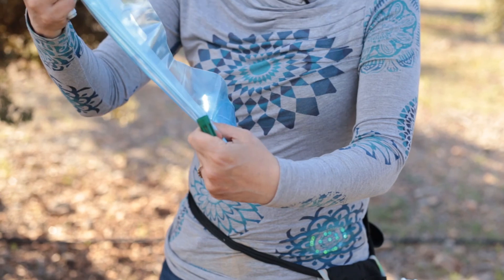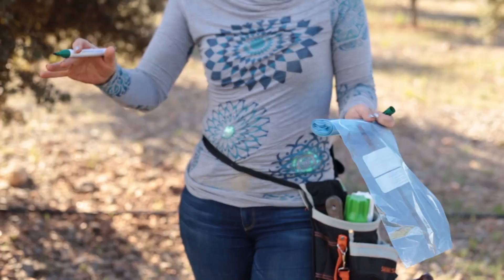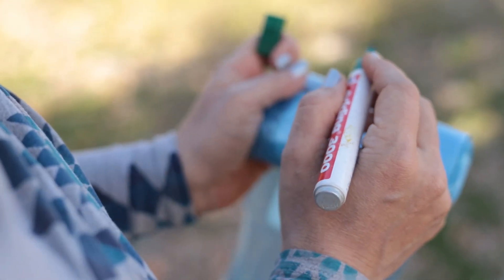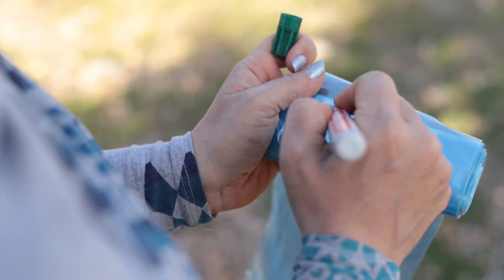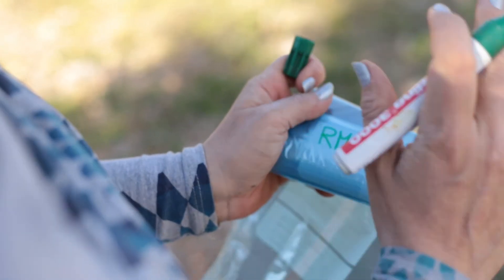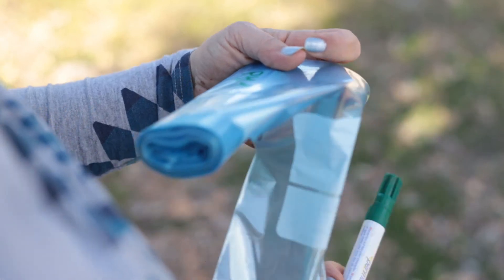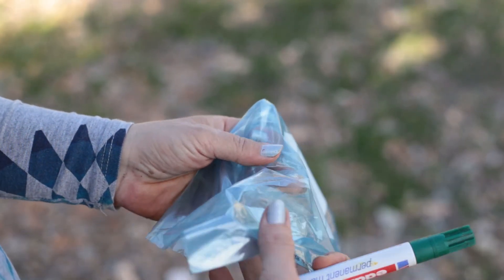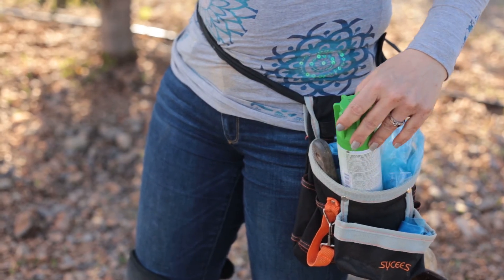This would be tree number one of our analysis. It's important to label it at the bottom so when you make a knot, the label is still visible — it's easier for us to organize the samples in the lab for extraction. This plantation belongs to a client whose initials are R.M., and this is tree number one. We recommend using freezing bags from the supermarket — they are sterilized and robust enough to use easily.